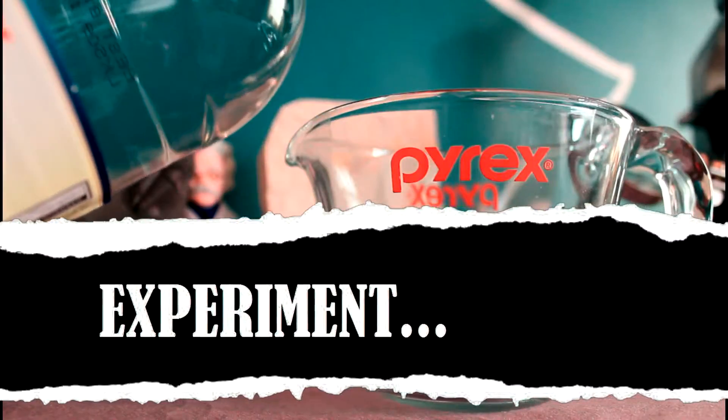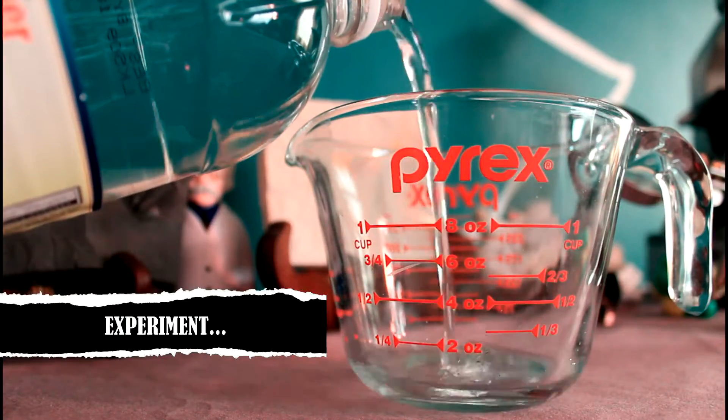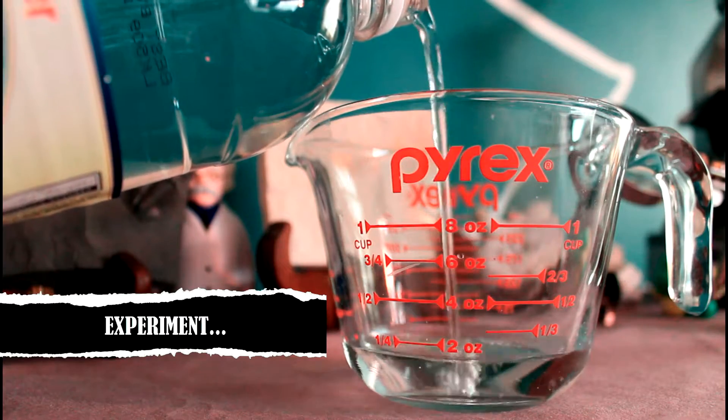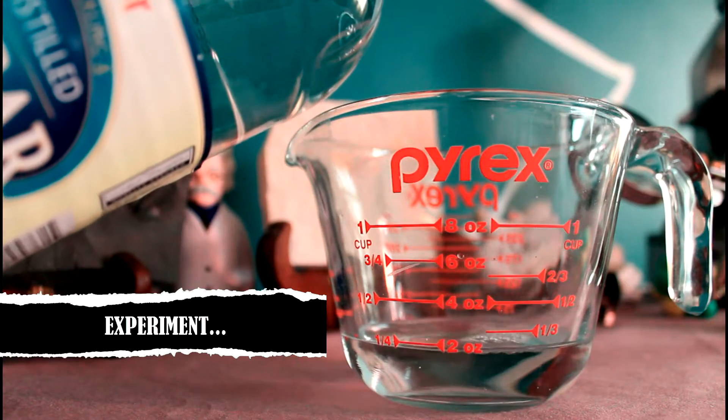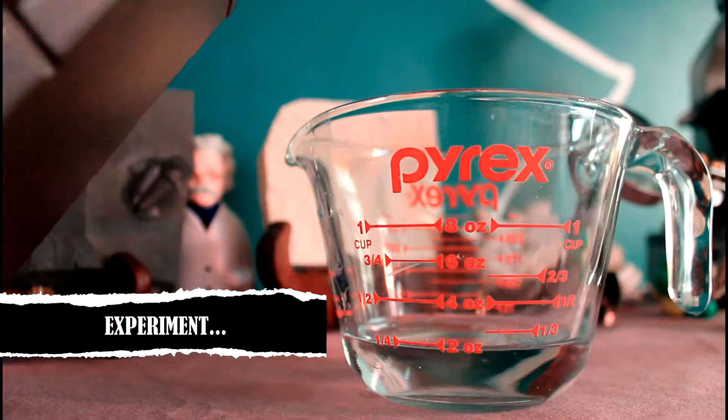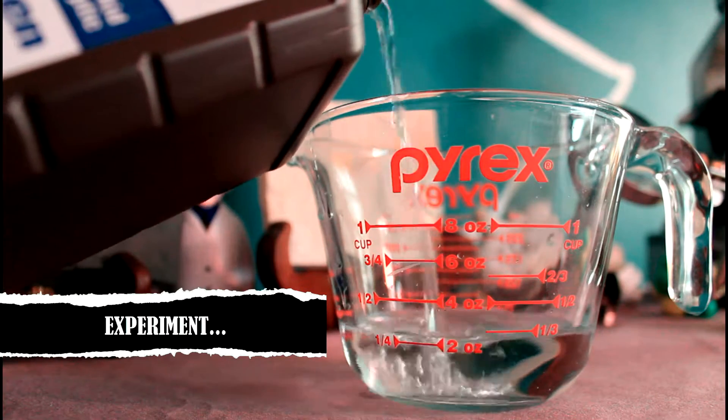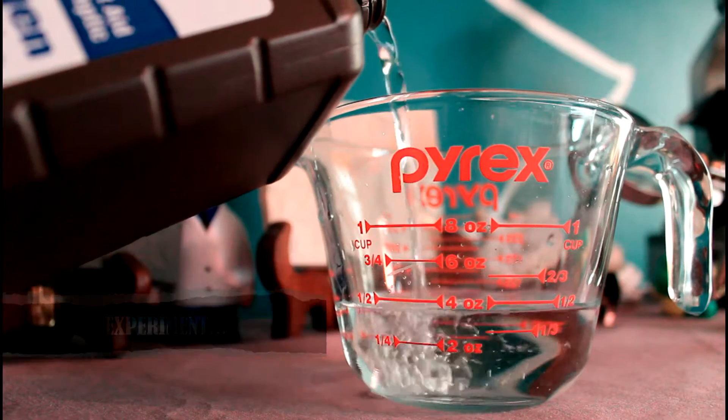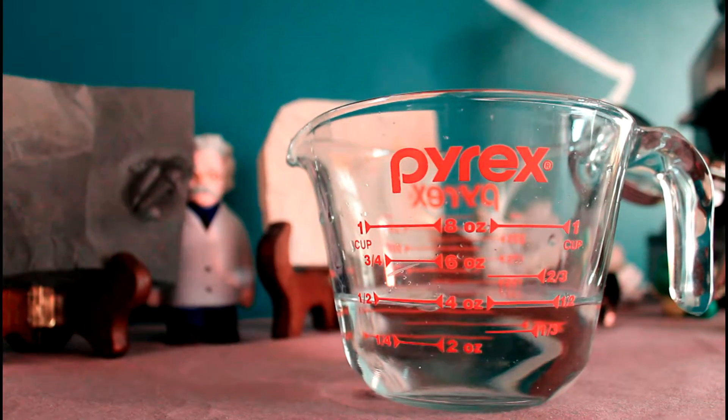Got your chemicals? Let's do some chemistry. To begin, start by pouring 2 ounces, or approximately 60 milliliters, of vinegar into your microwave-safe glass container. You need to add to that an equal volume of hydrogen peroxide. And these measurements don't have to be perfect. You can just eyeball them, but you do need to have roughly equal volumes of the two.